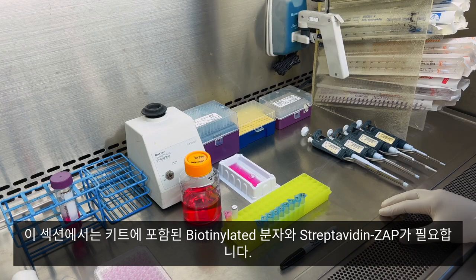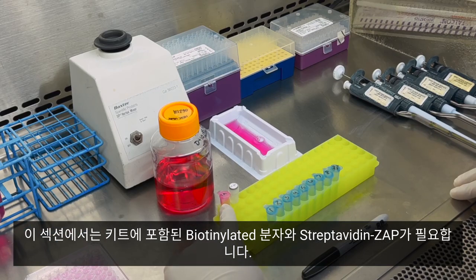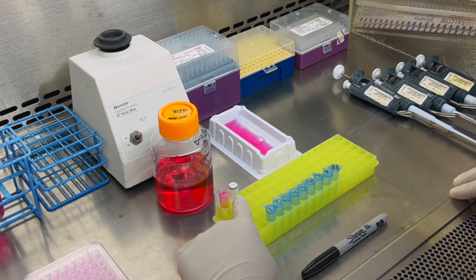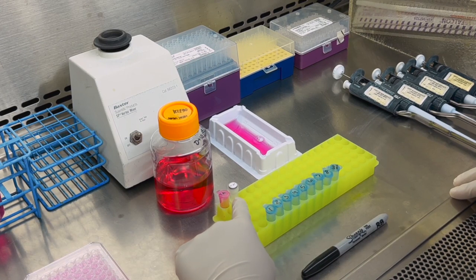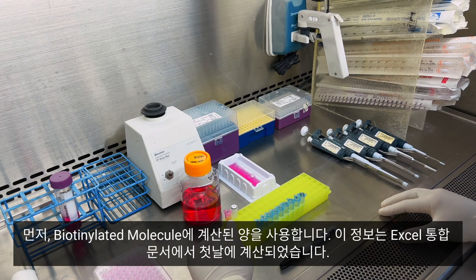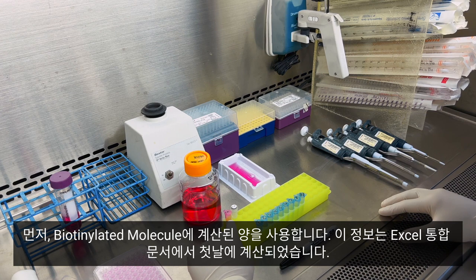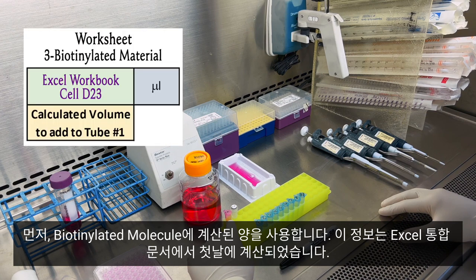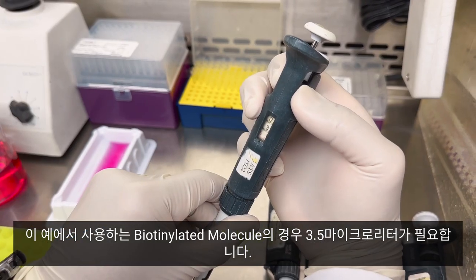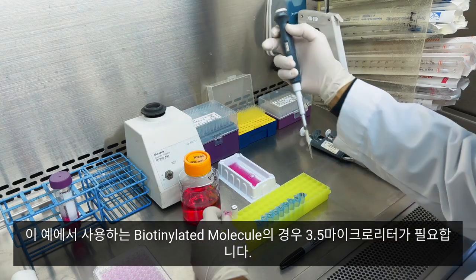In this section we need the biotinylated molecule and the streptavidin-ZAP that came in your kit. First we'll use the amount calculated for your biotinylated molecule. This information was calculated on day one in the Excel workbook. For the biotinylated molecule I am using in this example, I need 3.5 microliters.